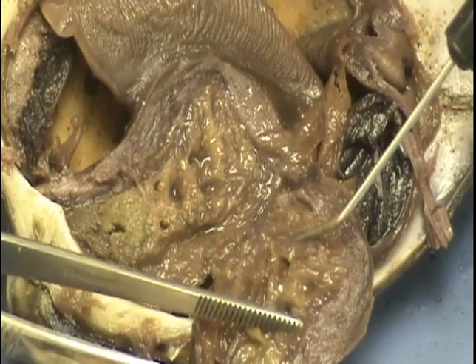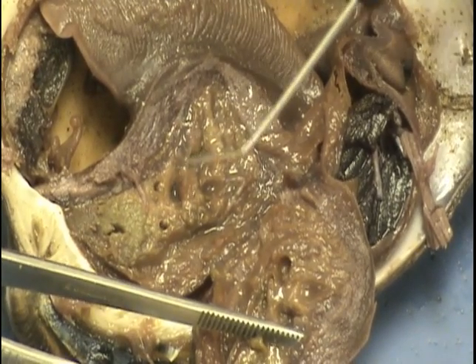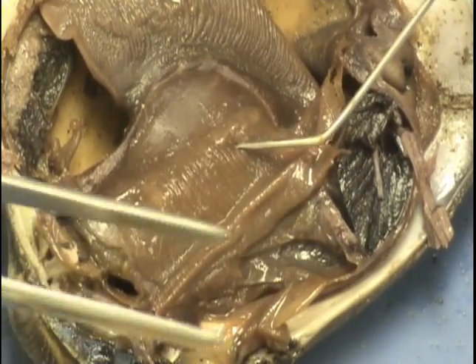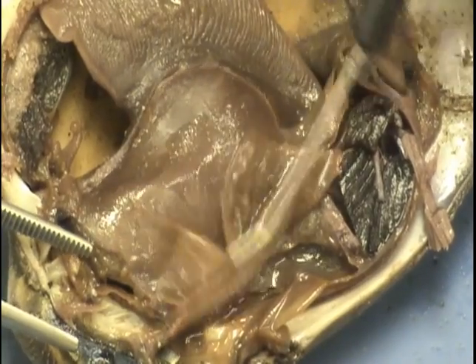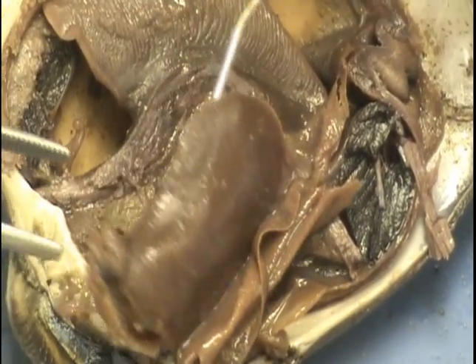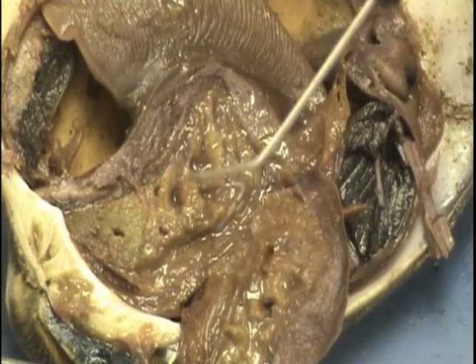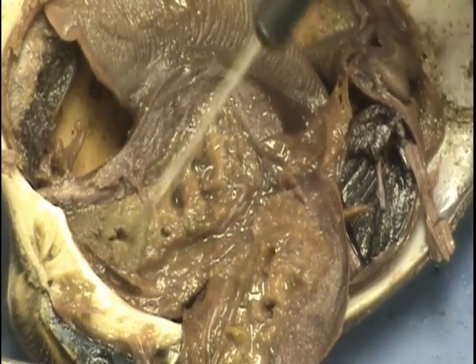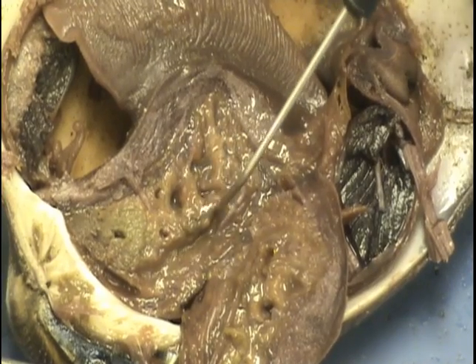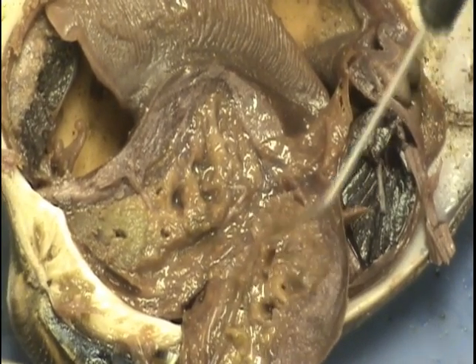What is surrounding the intestines — which looks kind of butterscotch-like — are the gonads. They actually produce the gametes. So again: that bump is the visceral mass. If I open the visceral mass, I find a green blob — the digestive gland — and inside that little space is the stomach. We've got little gristly tubes — that's the intestine — and the butterscotch stuff is the gonads that produce the gametes.